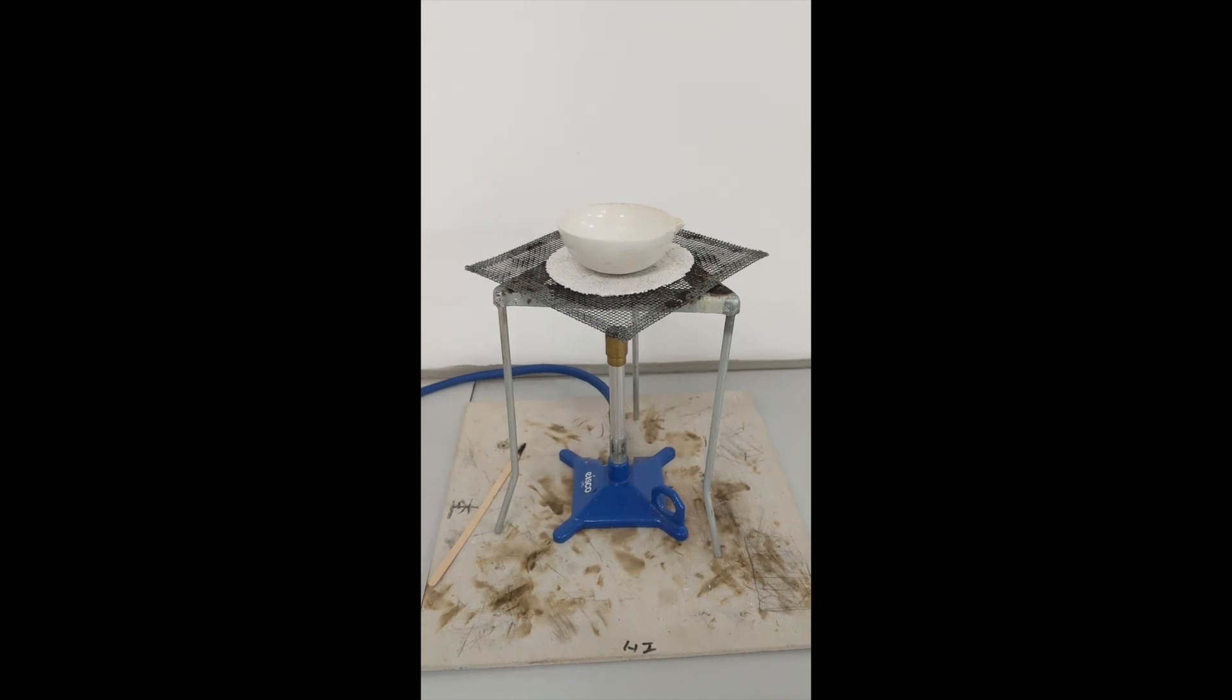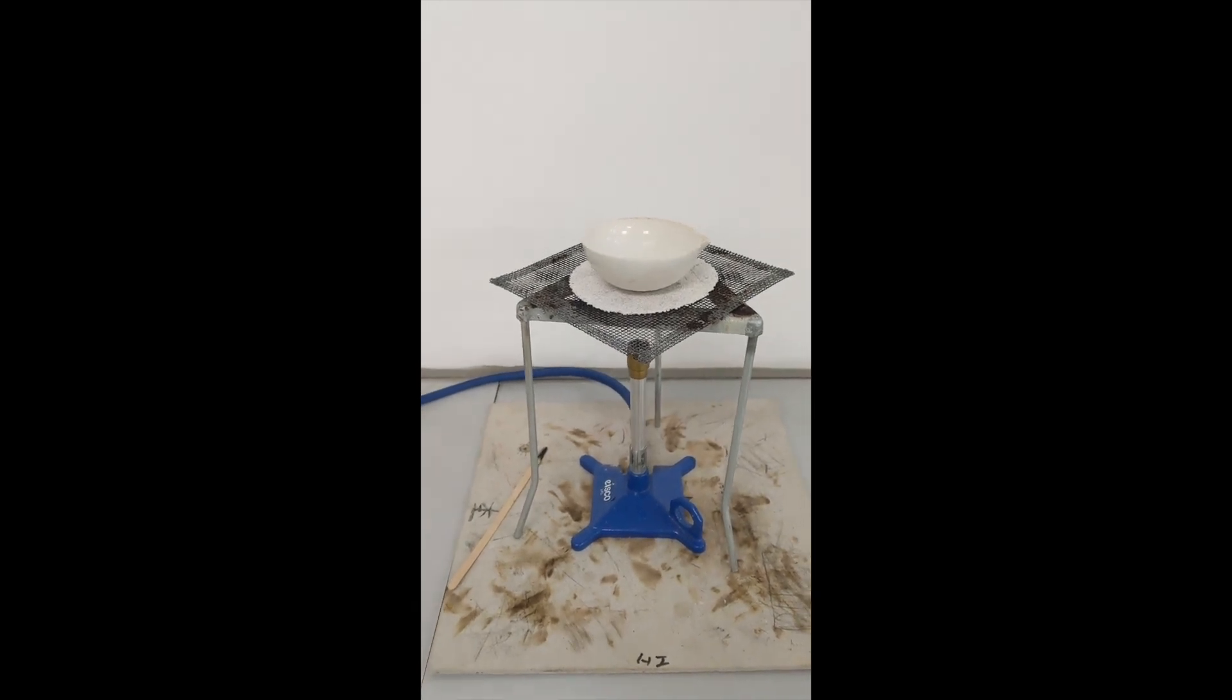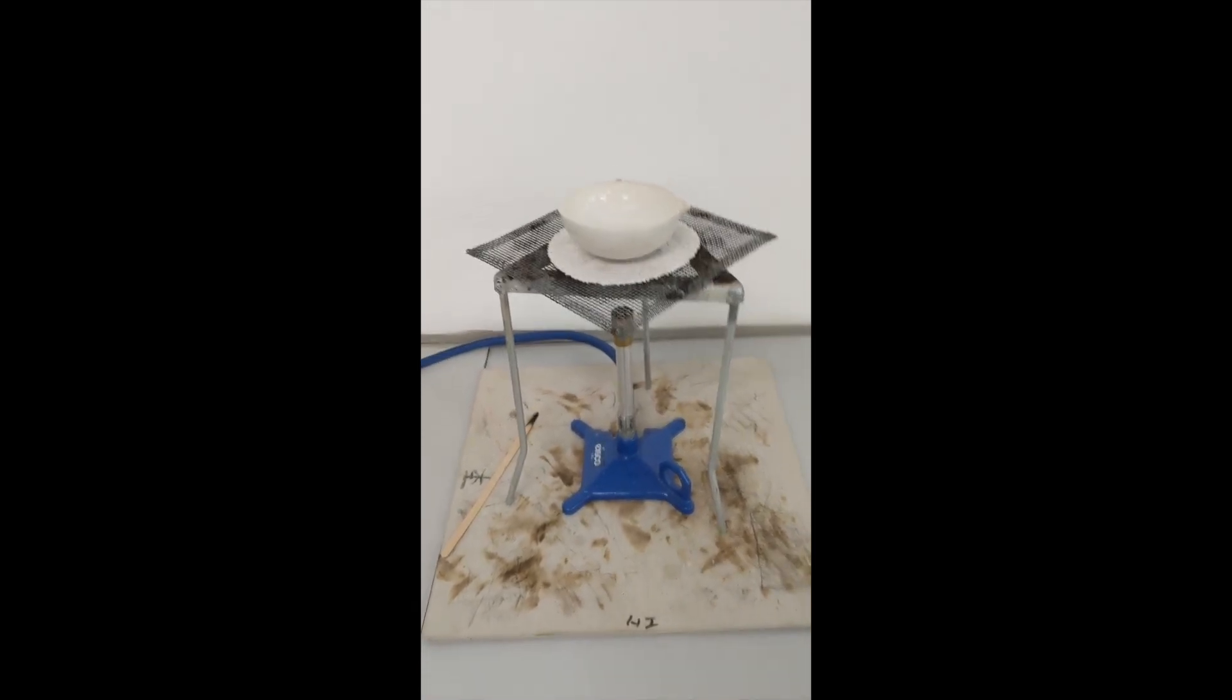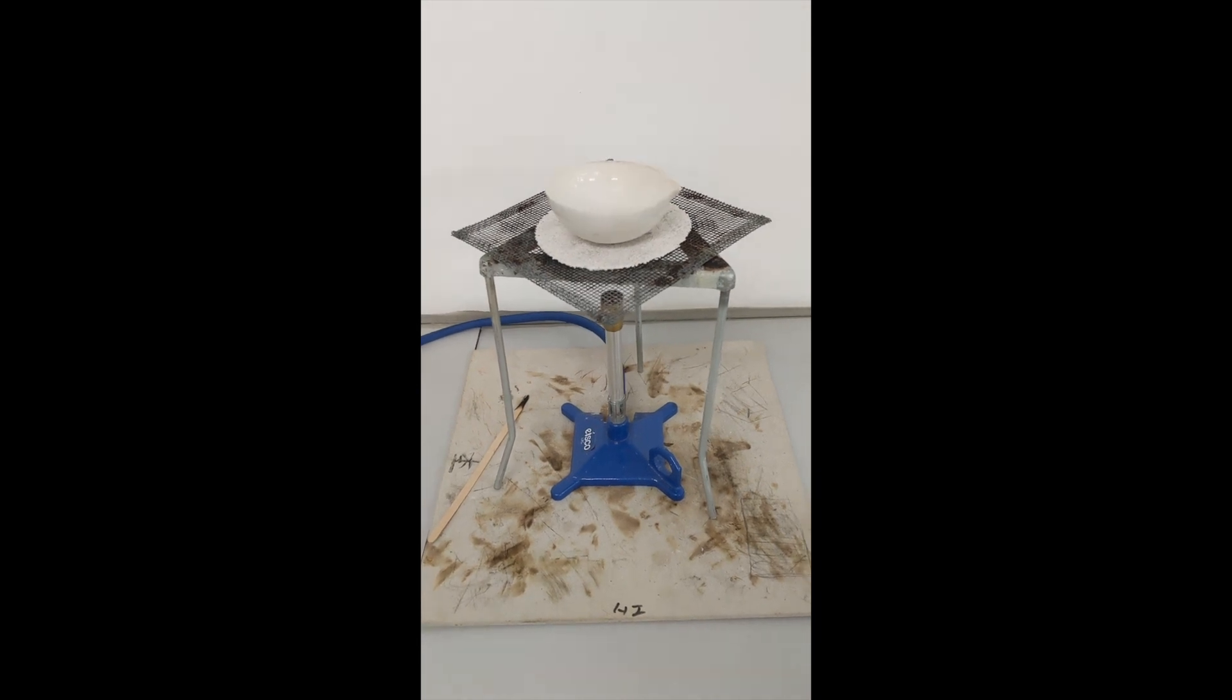And then I'm just going to leave it. I'm not going to touch it because it's going to stay very, very hot.